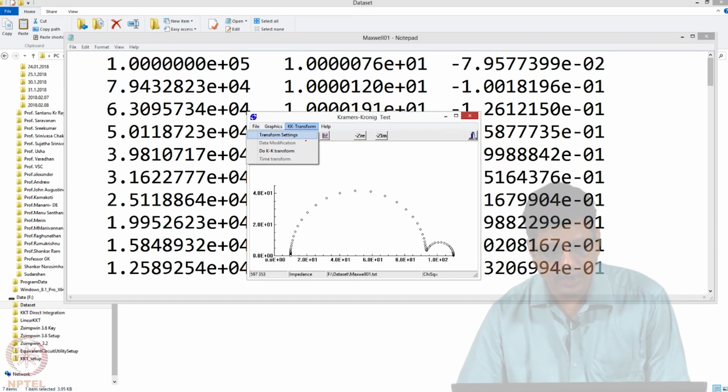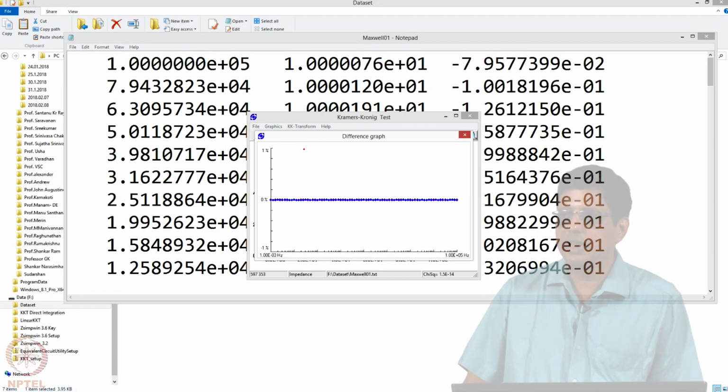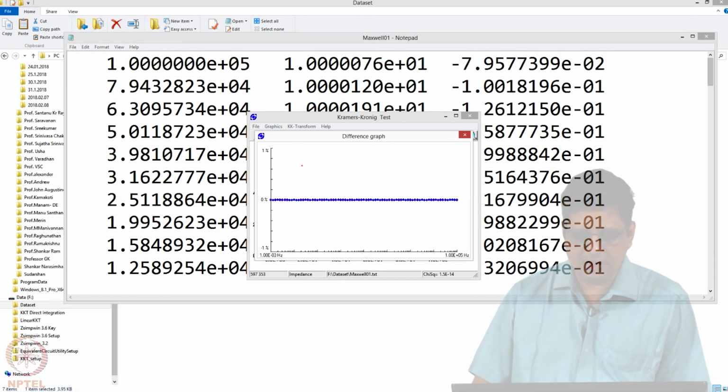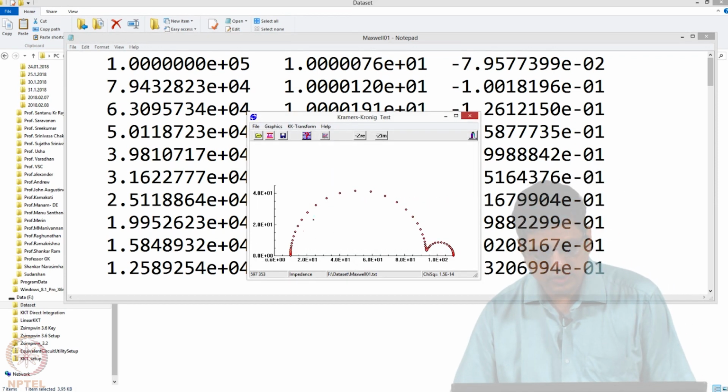So if you say do KK transform, it will do the transform and tell you the residuals, how they are as a function of frequency. Frequency is from 1 millihertz to 100 kilohertz here and of course, this is synthesized data. So it is 0. It fits exactly. And you see now black and red. This shows that the transform data and the original data are overlapping exactly, which is what you would expect for a clean data like this.